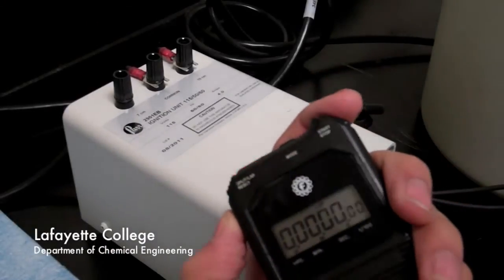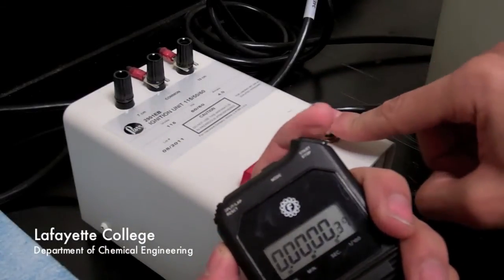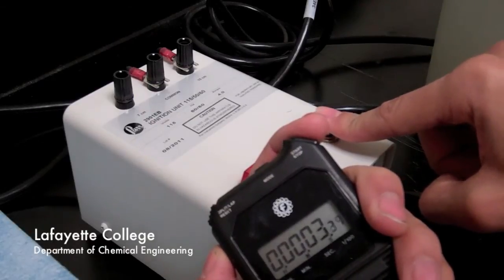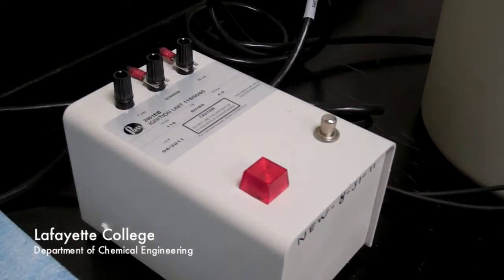To fire the bomb, restart the timer while simultaneously depressing the ignition key for 3 seconds. The red light may not stay lit for the entire 3 seconds. Stand clear of the bomb for 30 seconds.